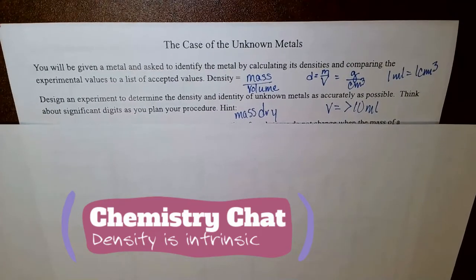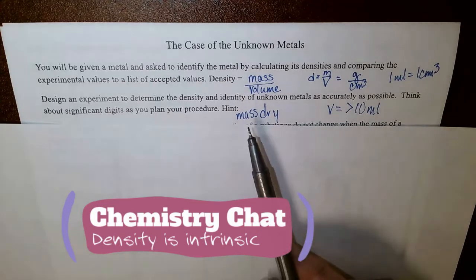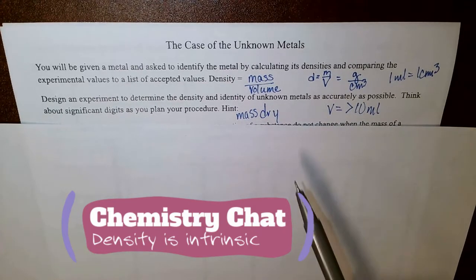Your task is to design an experiment to measure the density and identify the unknown. And also think about significant digits as you plan your procedure. I have a couple helpful hints here for you.